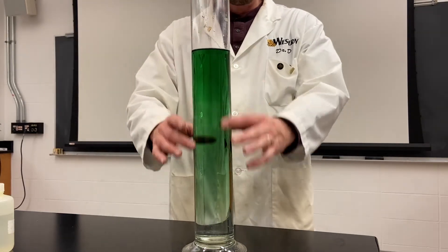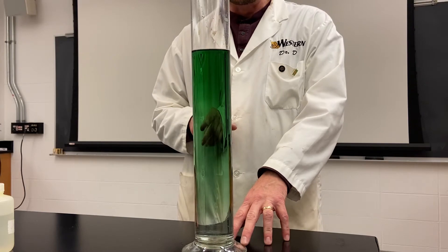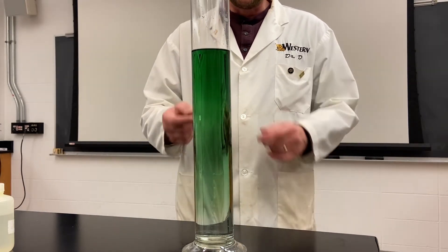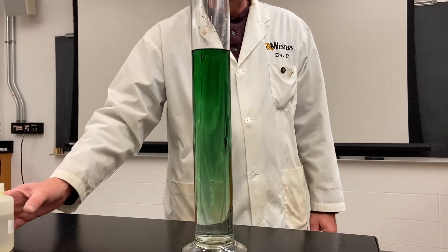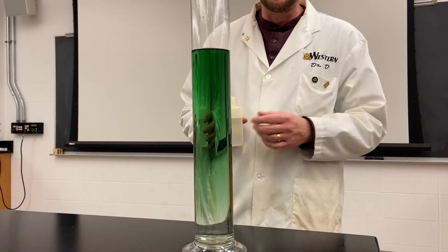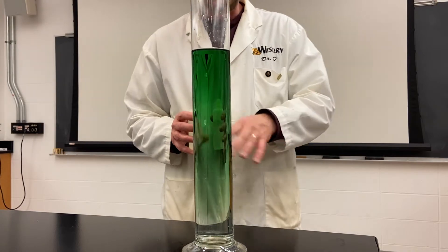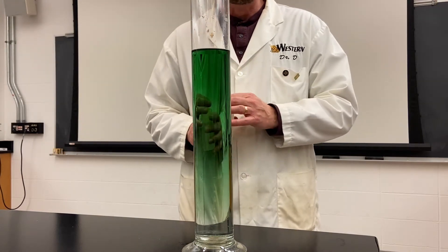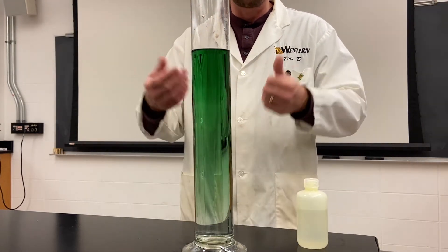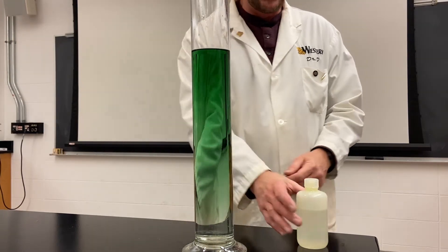What I've got here in front of you is a cylinder with some tap water in it. I've added something called universal indicator, which is going to tell us about the relative acidity of the water. Right now it's green, and green in universal indicator means it's about neutral pH — not really acidic, not really basic.